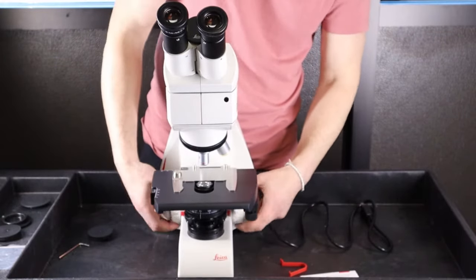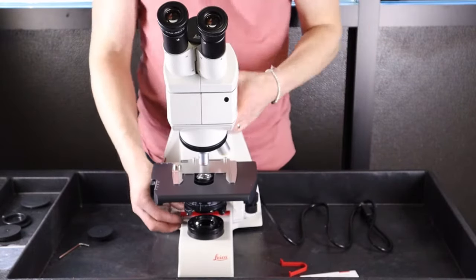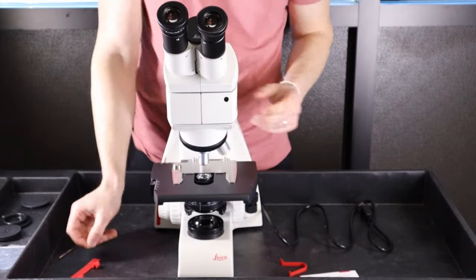Now bring the focus all the way up, which gives you access to lift and remove the bottom lock.